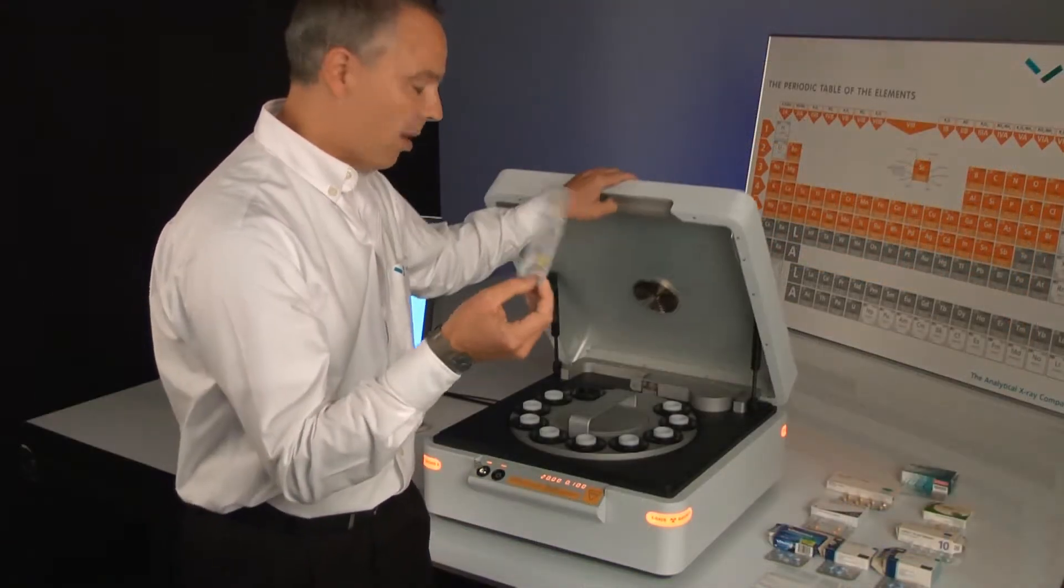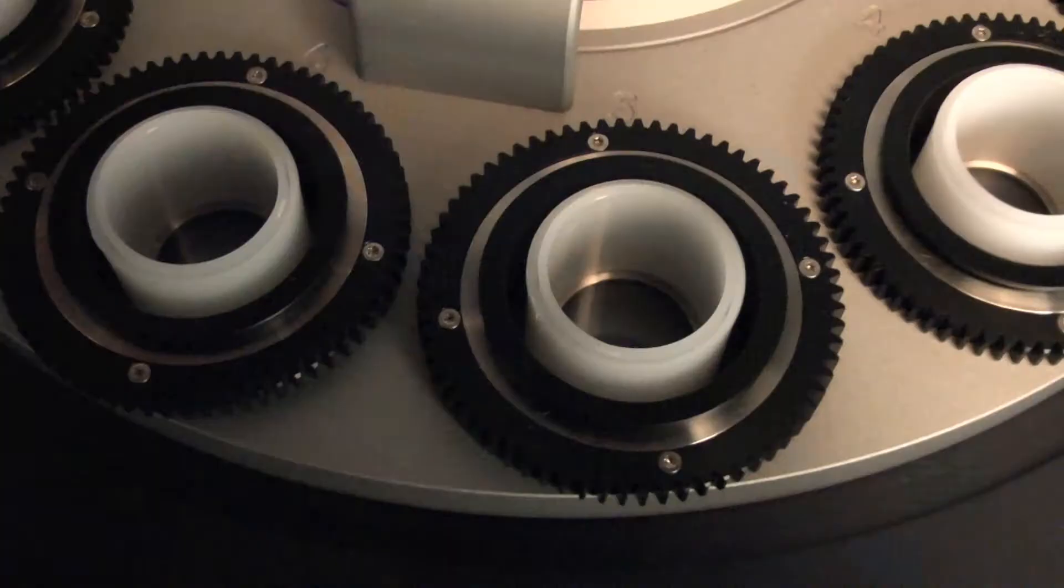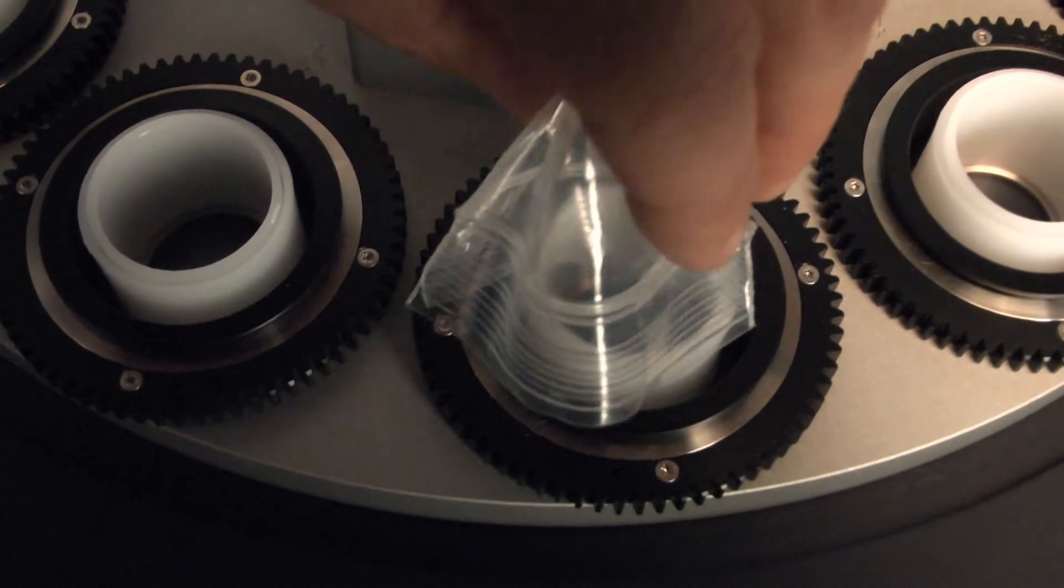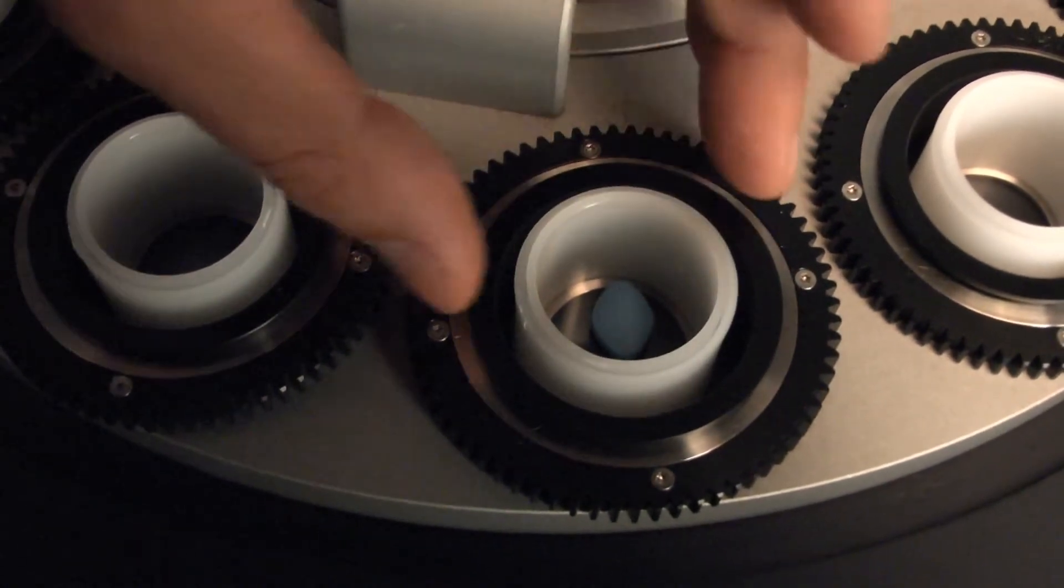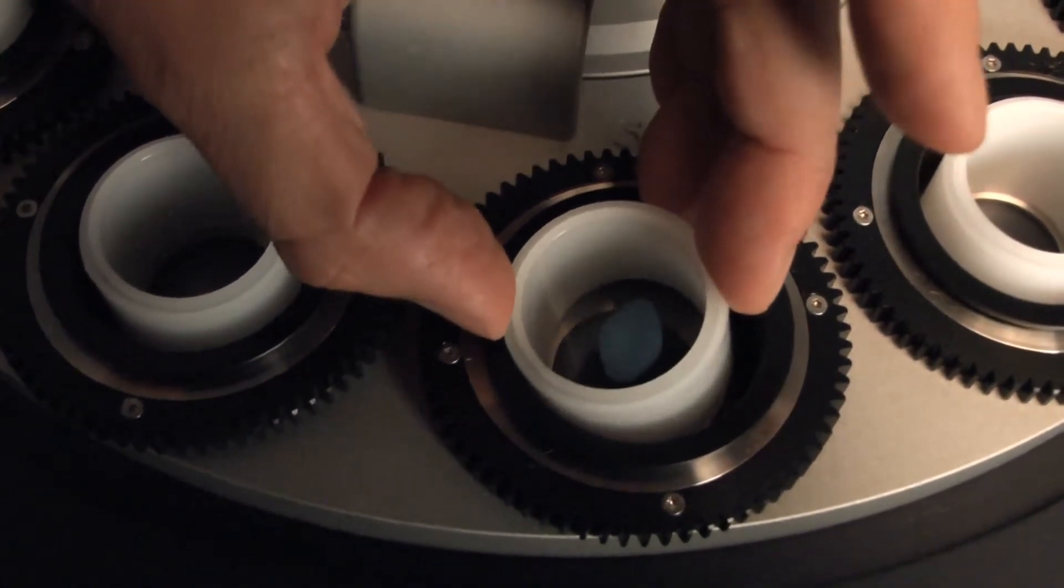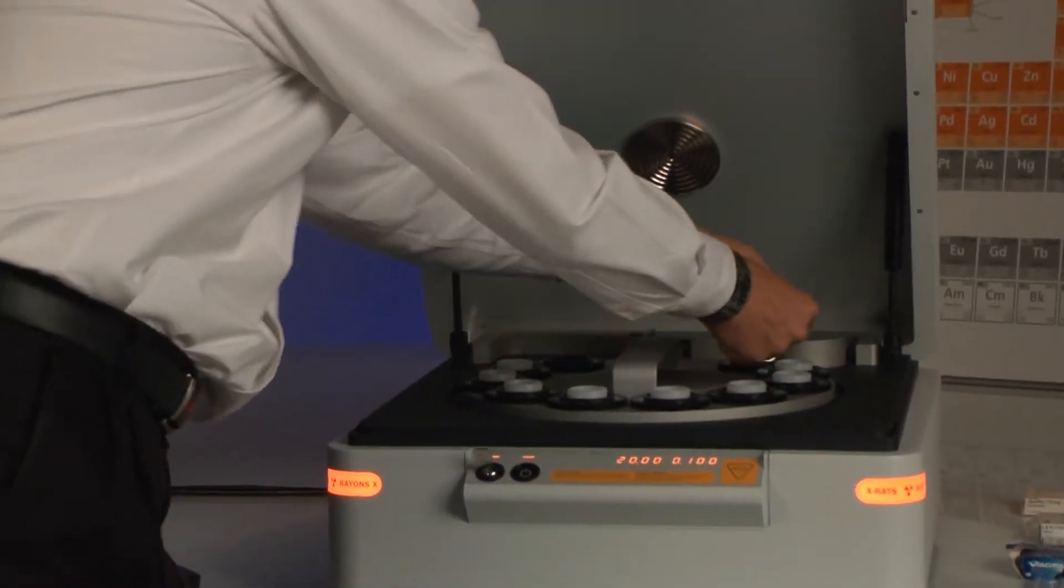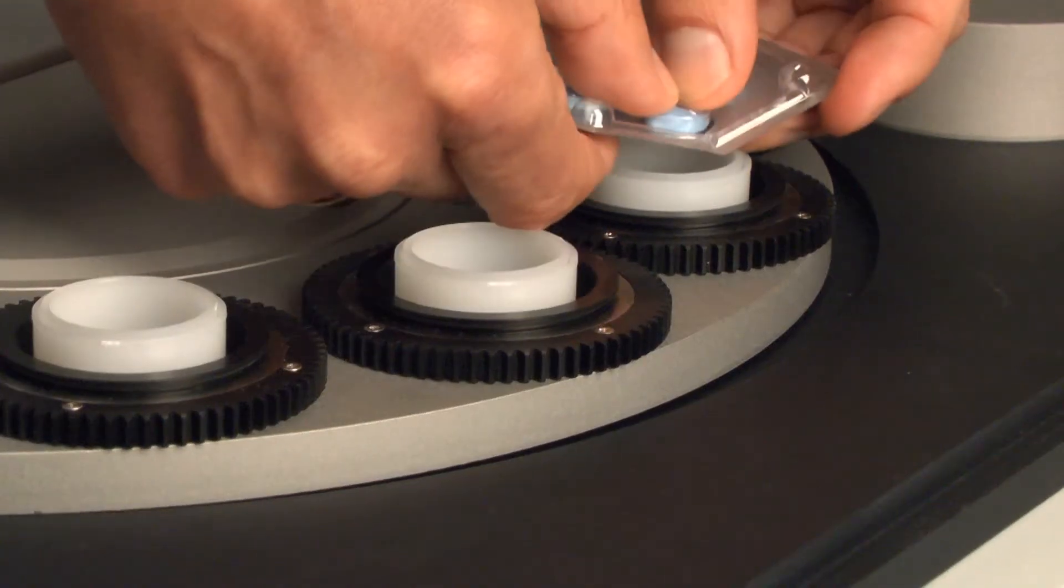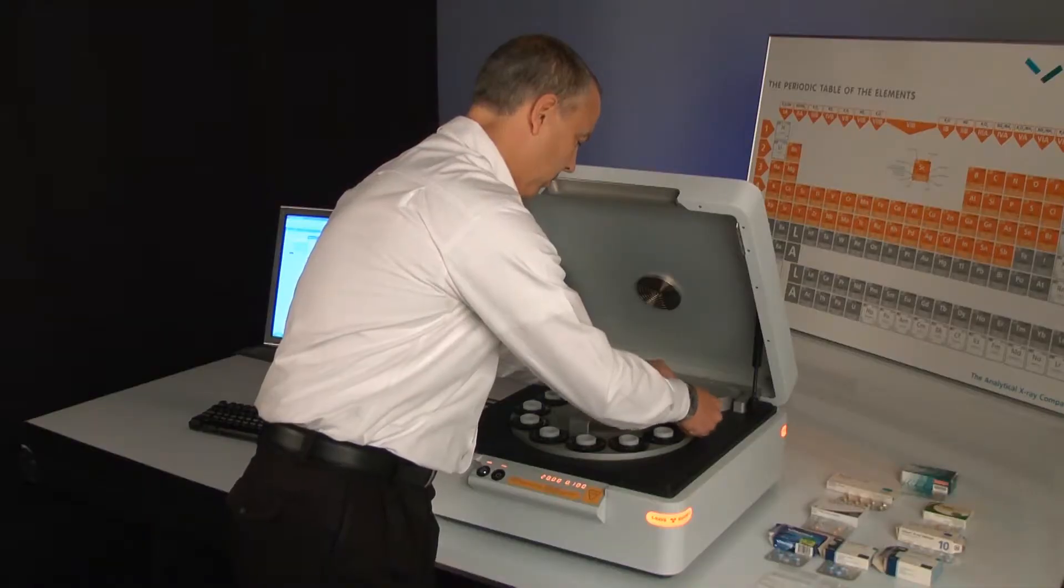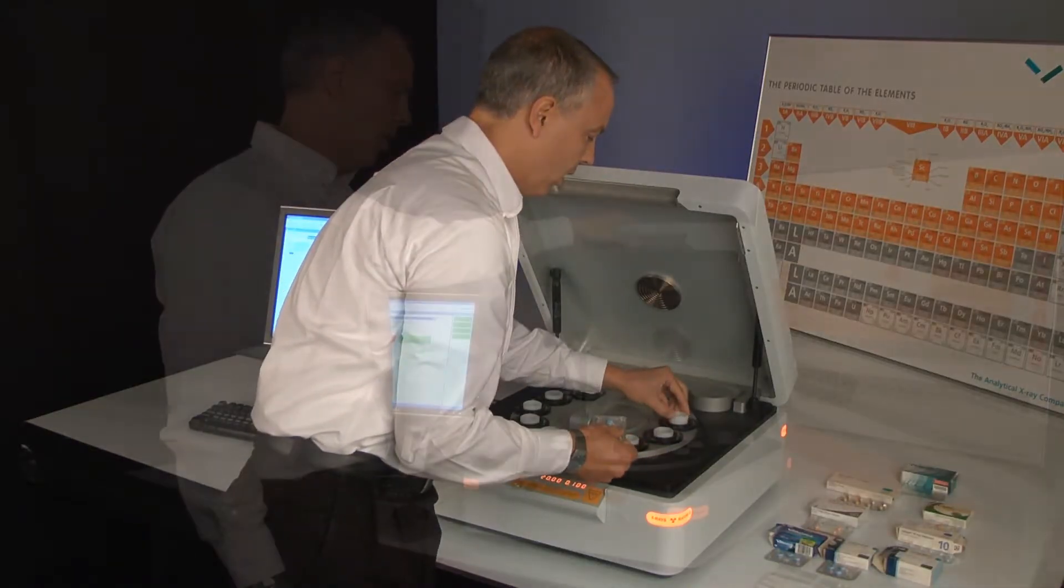Let's take this tablet, a fairly convincing-looking fake, and we'll drop it into a cup. We'll do the same with an unopened tablet from a blister. We center them.